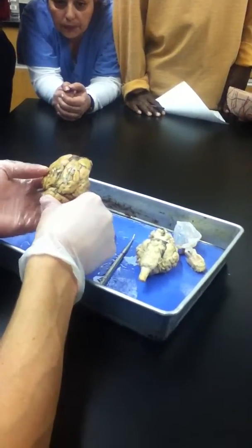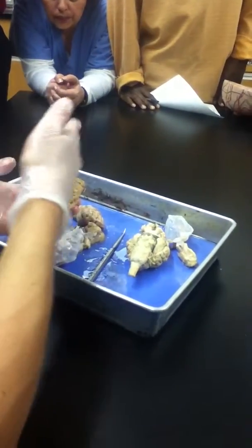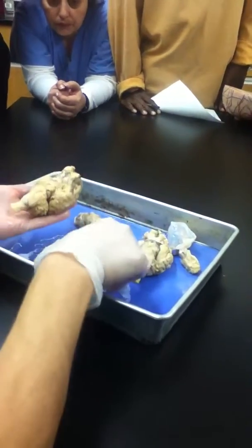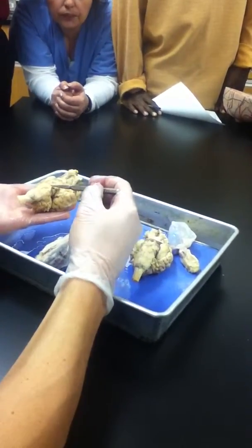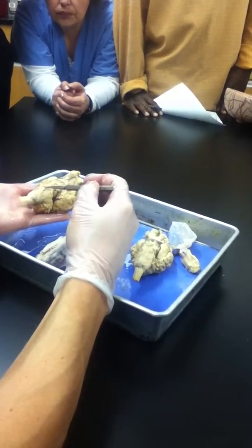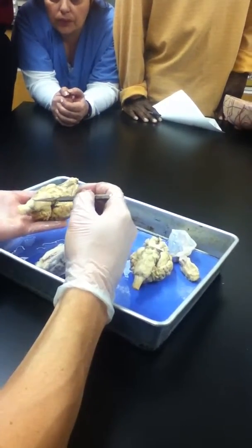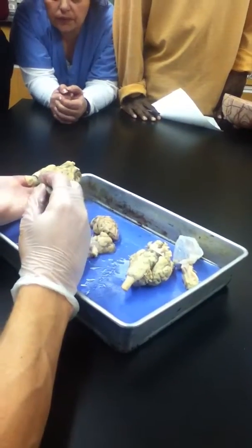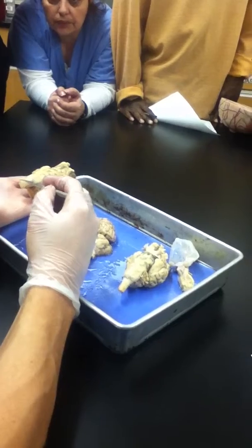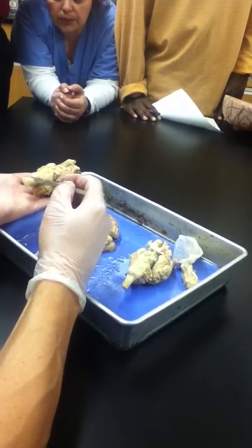All right, good. So that's pretty much everything I could ask you from this angle. Lobes, fissures, the membranes, things like that. When we flip it over this way, we get a few more details. Take, for example, this is all brainstem here, and it's not so pronounced, but there's a bump right here. The pons, good. What is the next region of the brainstem after that? Medulla oblongata. Then it really gets much thinner right here. Good, it becomes officially spinal cord. So it goes pons, then medulla oblongata, then finally spinal cord.